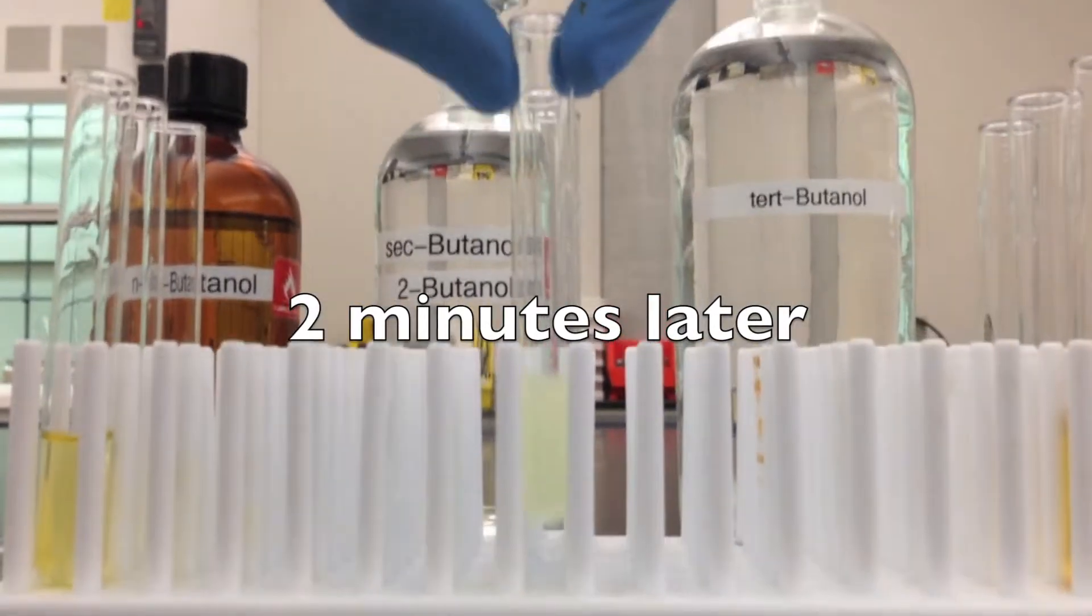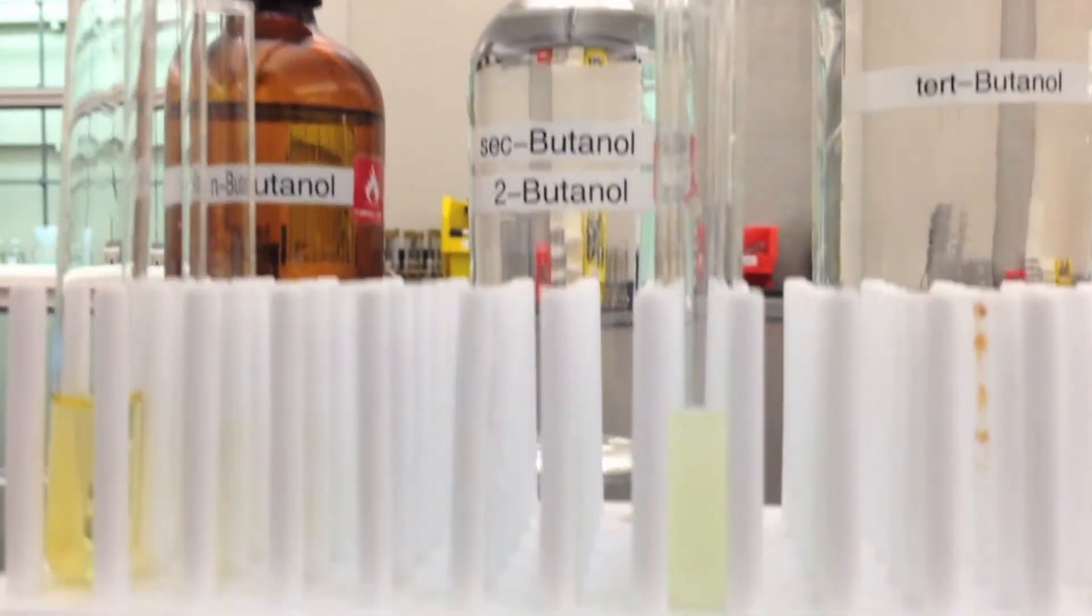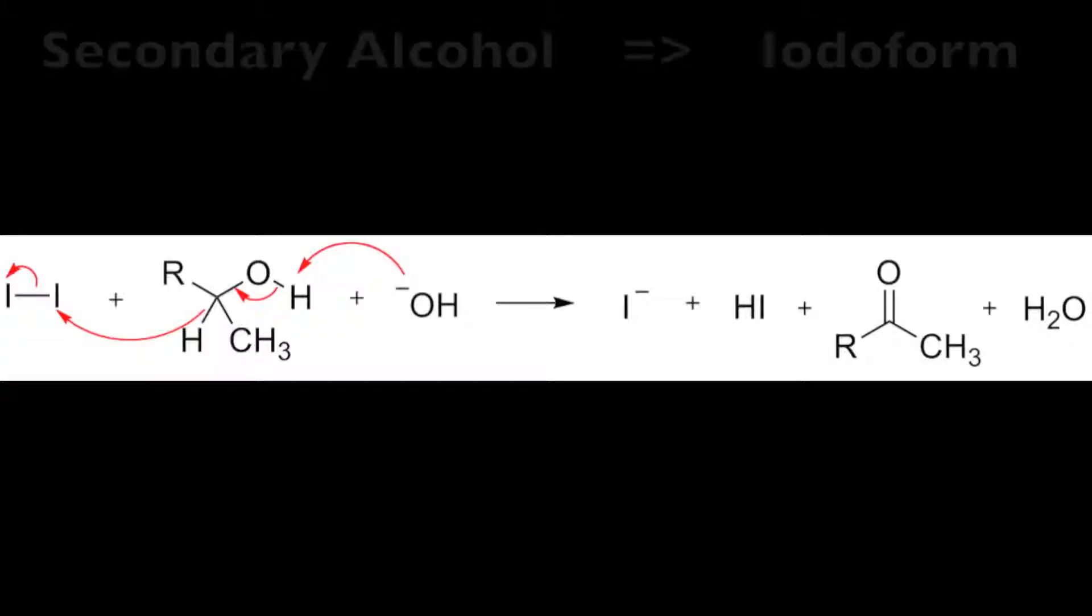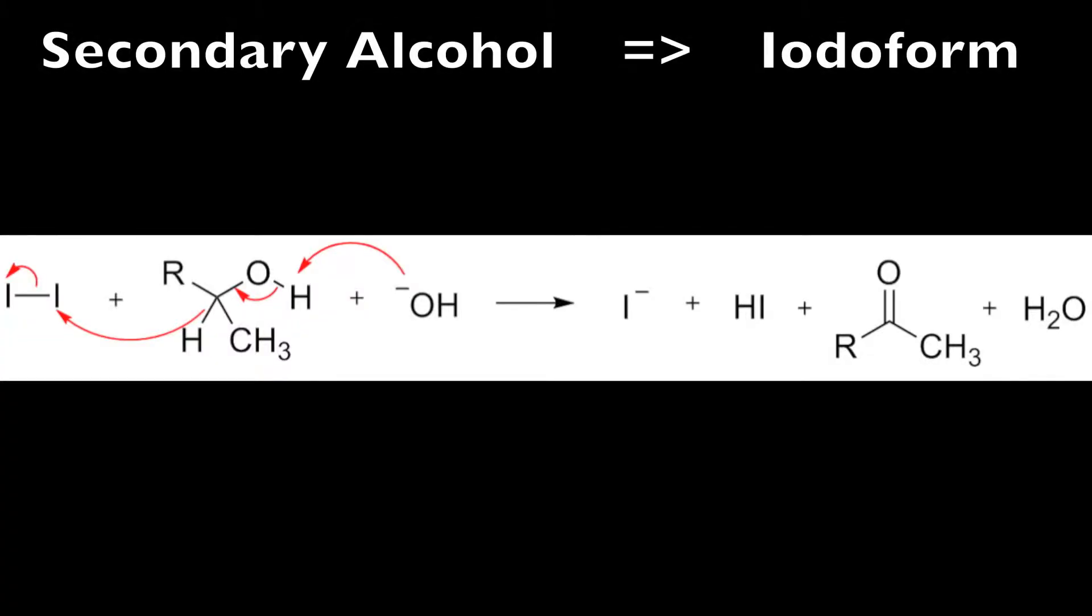As you can see, we've gotten a positive reaction with our second alcohol. So we can reasonably assume that that could be the secondary alcohol.